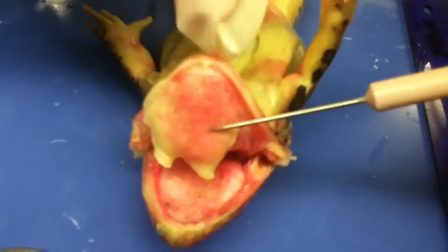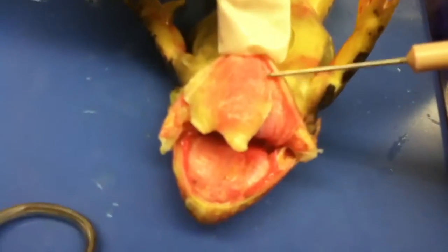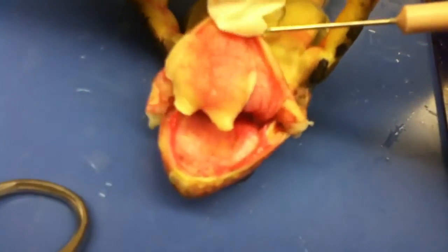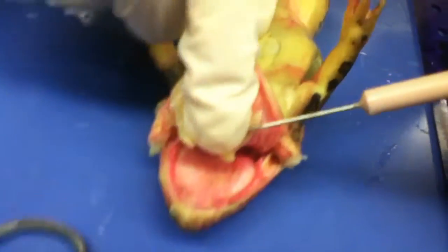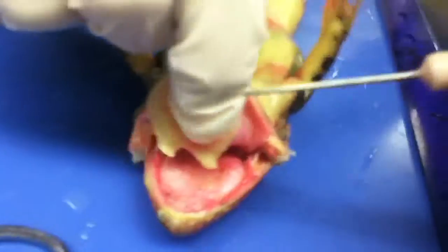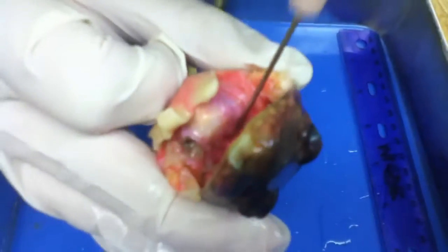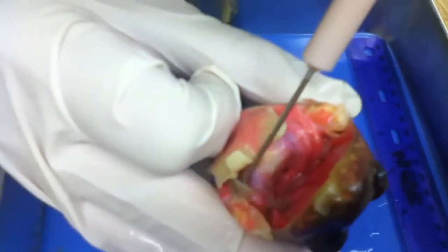Find the tongue. Right here? Is it that thingy right there? Yep, this is his tongue. How does this extend up? Find the pharynx. The pharynx — well, here's how it's pointing to. Right here — that would be at the bottom, right here in his mouth. The pharynx is right here. Look, you can see it. You see it? If you see it, I guess I'll check it out.